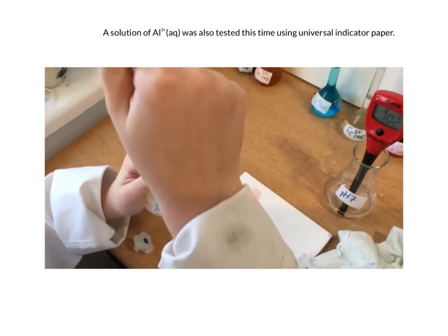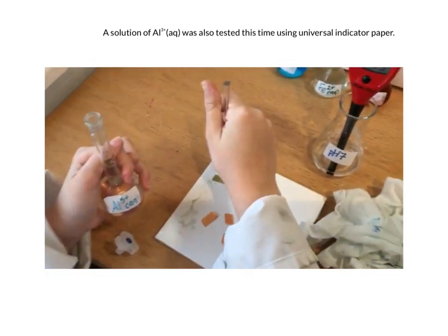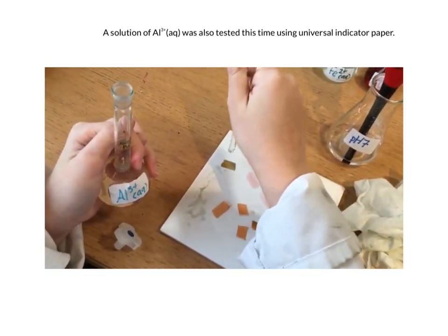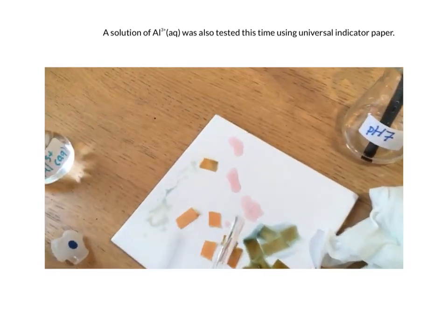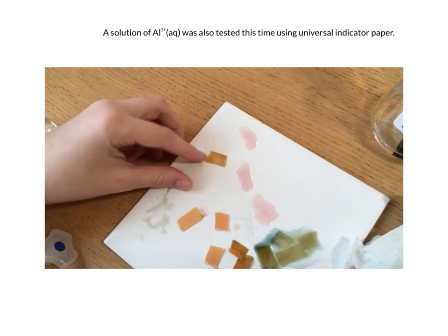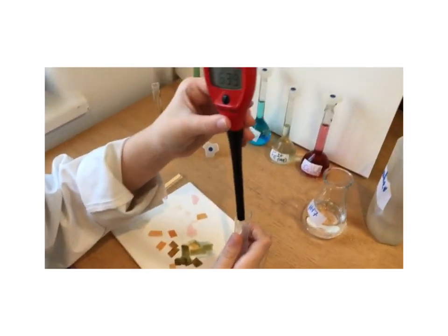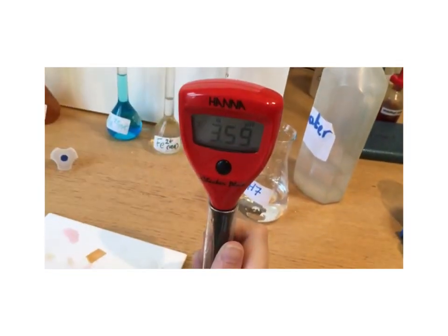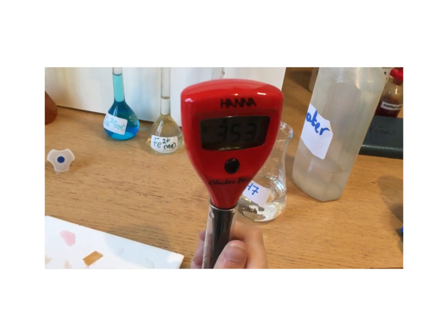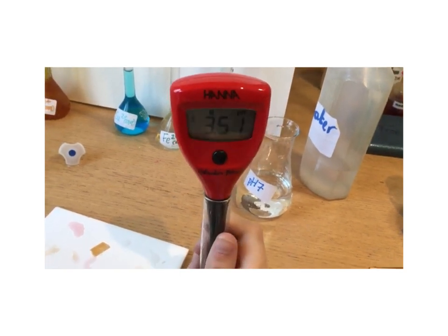We decided to test that with another 3+ ion. This time it's aluminium 3+. First of all, we tried some universal indicator paper, and you can see that the orange colour means it's acidic. So we decided then to take the pH. We immersed the pH probe in a solution of Al3+ ions, and you can see that the pH dropped to about 3.5. So aluminium ions are also acidic in aqueous solution.